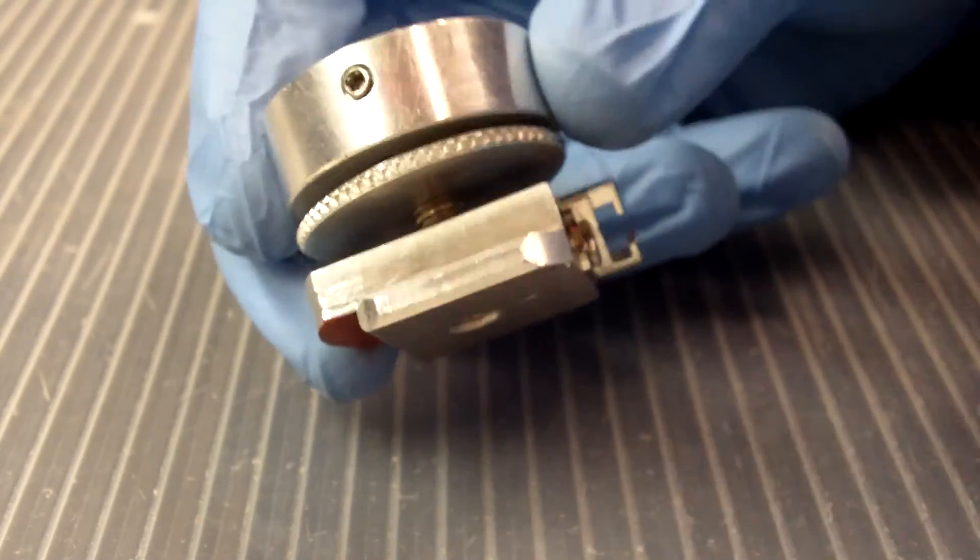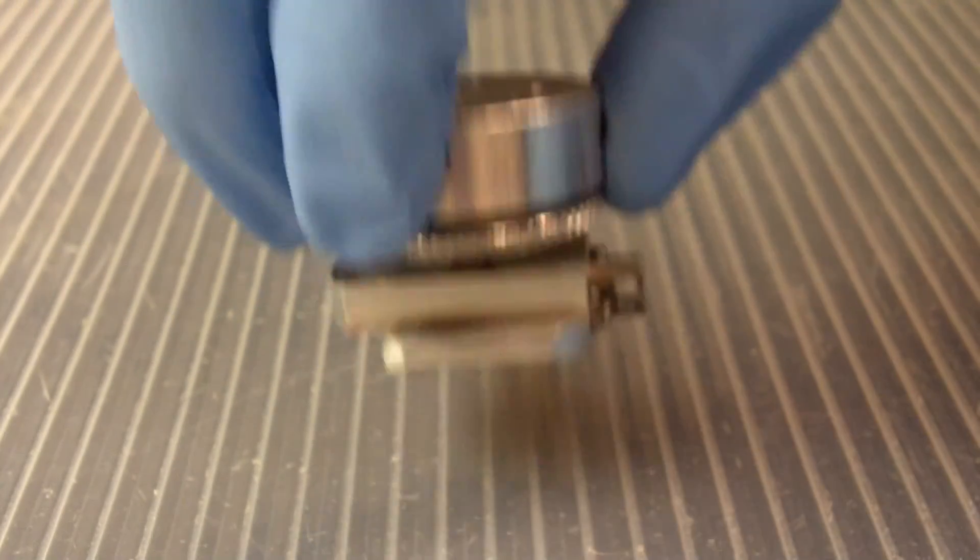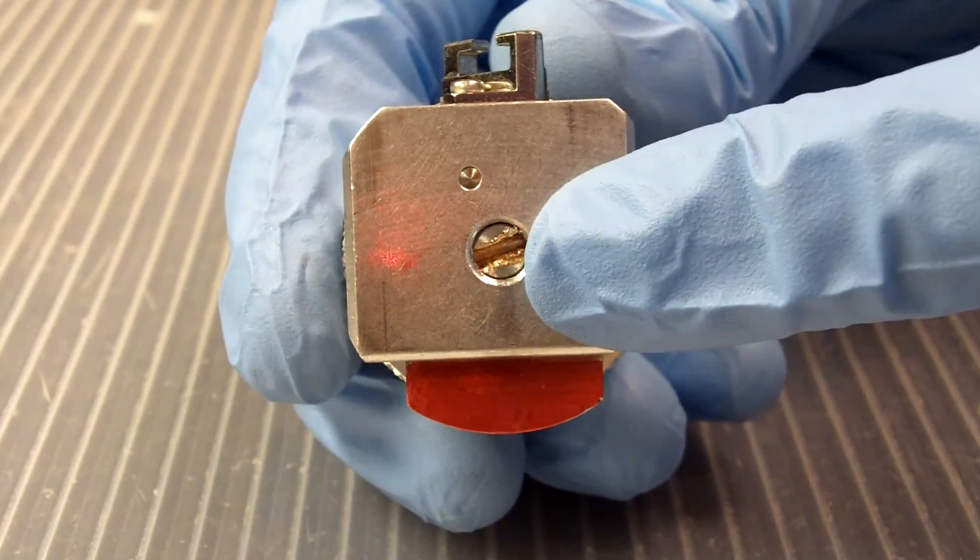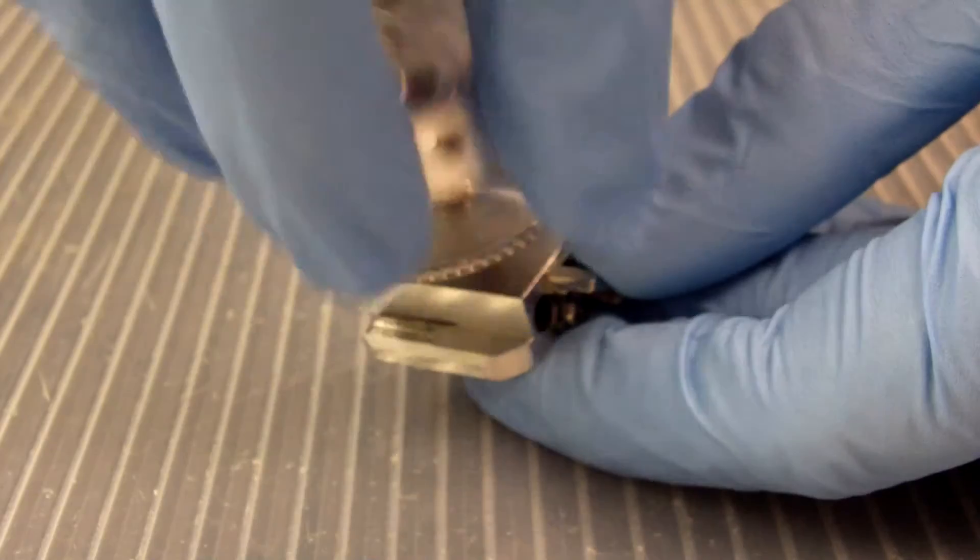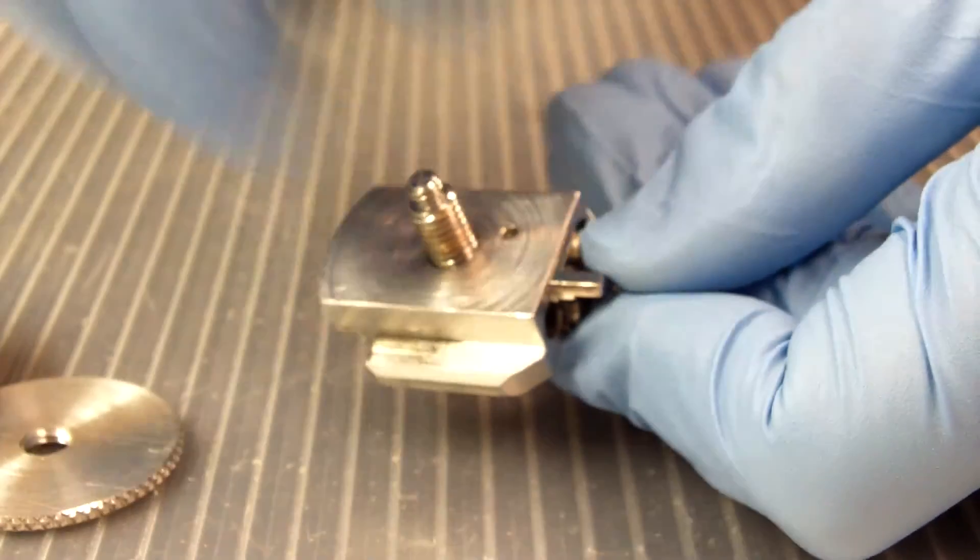It does not immobilize the screw. So that means that when we screwed the platform onto the end of the screw, it screwed the screw and got it jammed right in here into the bottom of the base. So if I try and take this apart right now, it is not going to come all the way apart. I can guarantee you. Look.